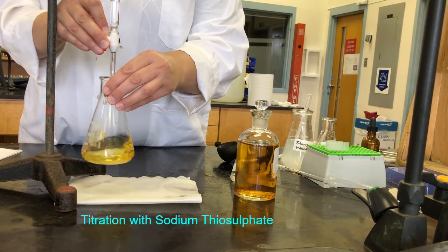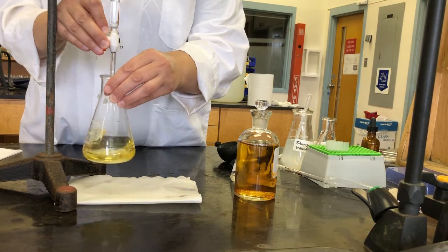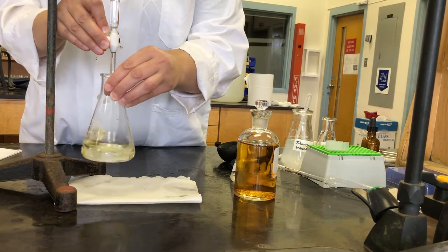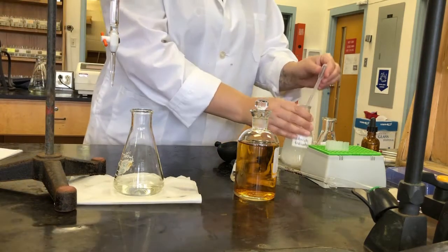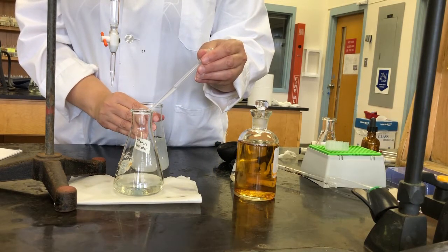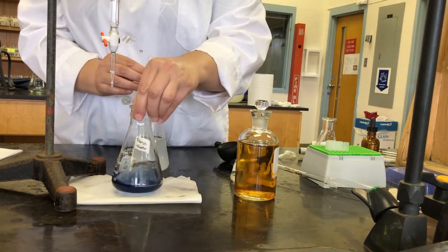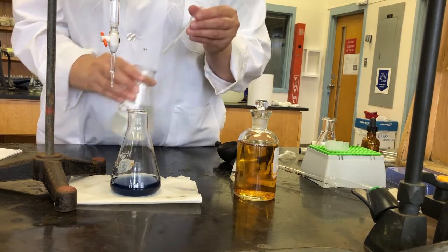We want to get just a trace of the yellow color. There we go, that's pretty good. Now we're going to add our starch indicator again. We want to add enough to get a deep blue color. Should be good.